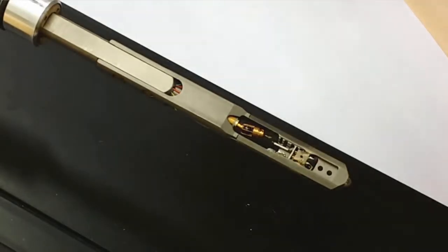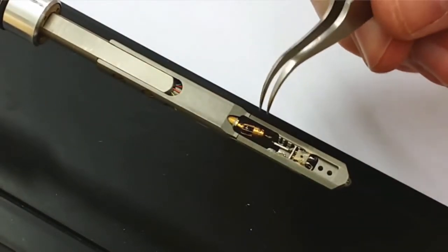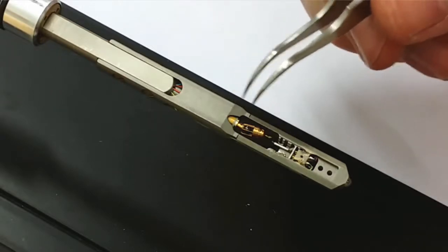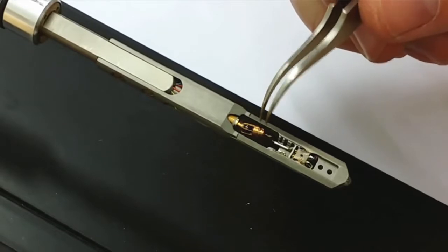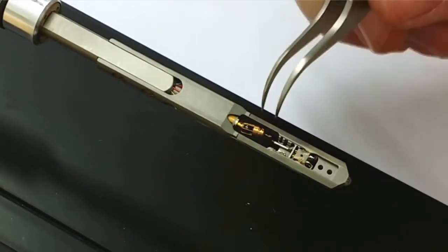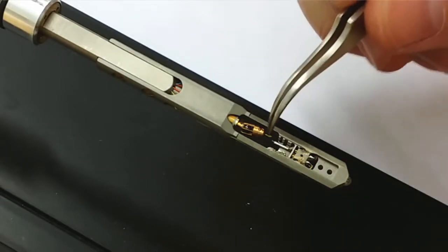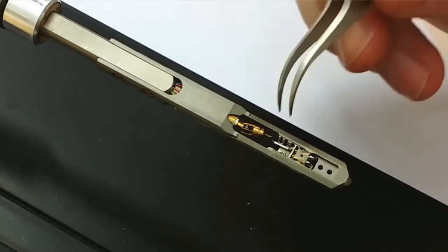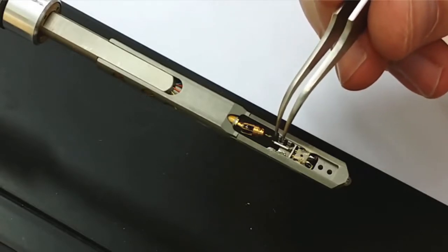This is the final sample holder that I'm going to show you. This is a much more advanced one. Here you have actually a moving probe on top of here. This probe you can use to probe in situ and contact the materials. Here you don't use these grids, but the sample is instead glued to a small metallic wire that you see here in front of the holder.